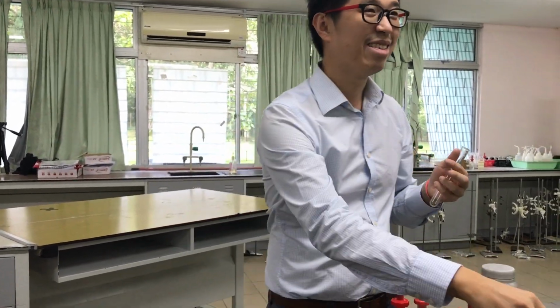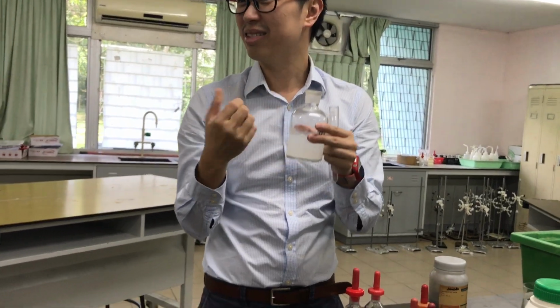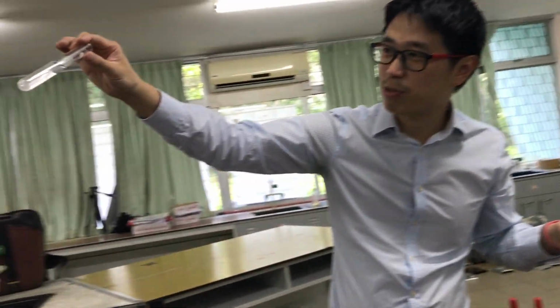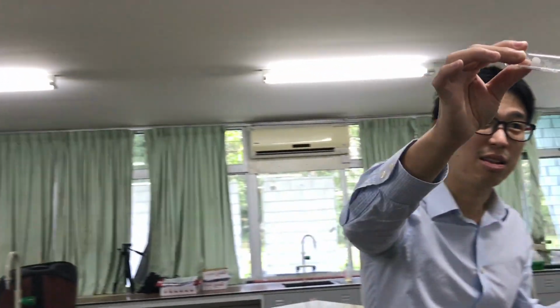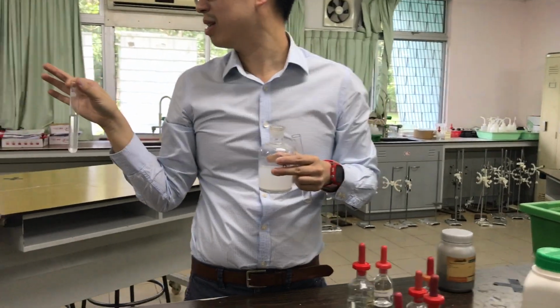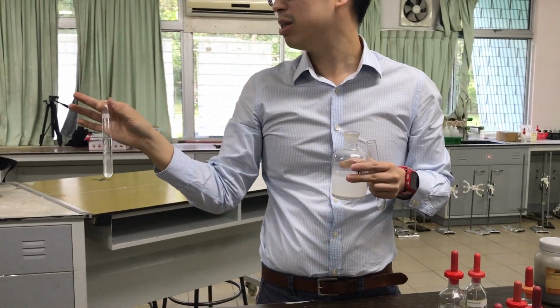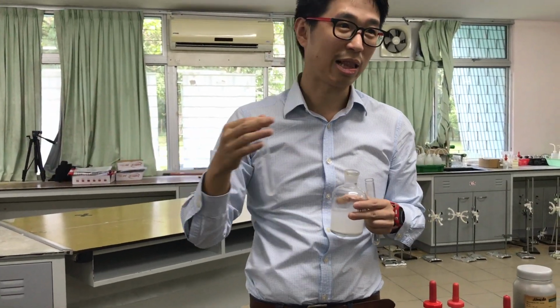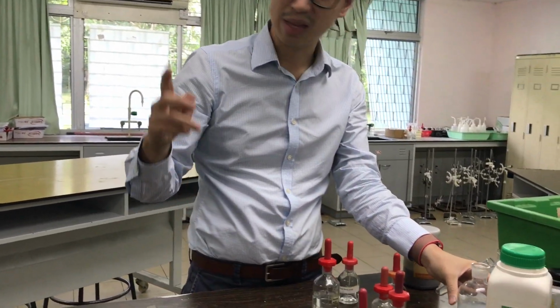What's the second gas? Carbon dioxide. You just did it. Remember just now the carbonate plus the acid, and then you get the white precipitate settled down at the bottom already. You have the white solid, lime water turns milky, right? That was the observation just now, the first one. Carbonate plus acid gives you carbon dioxide. What is the test for carbon dioxide? It turns lime water milky. That was what Nazrul helped me with.